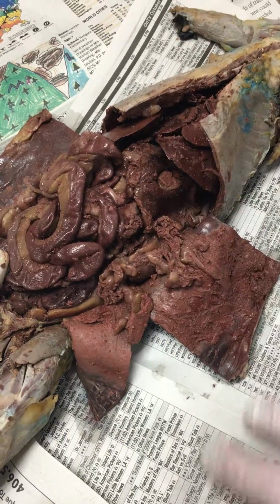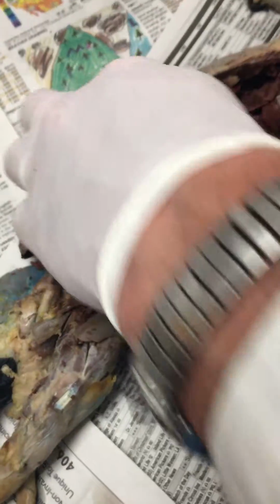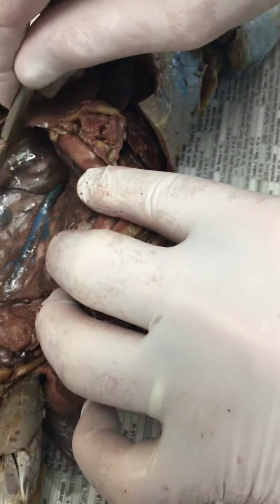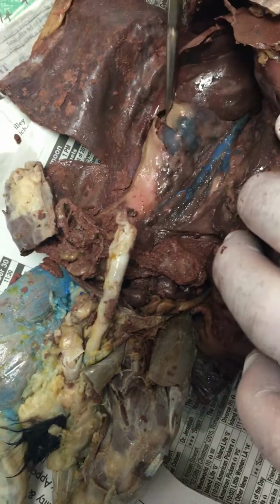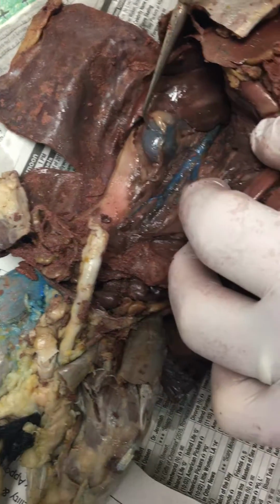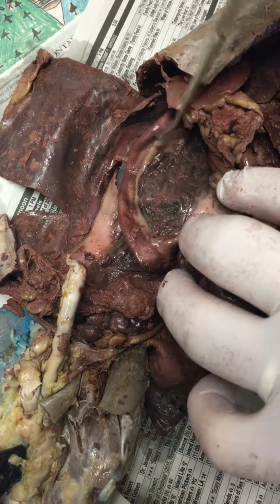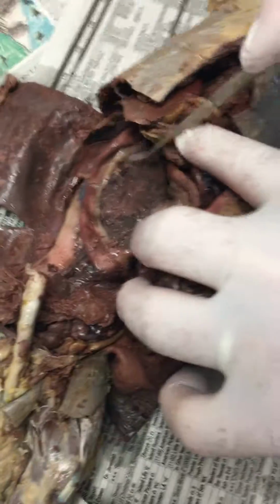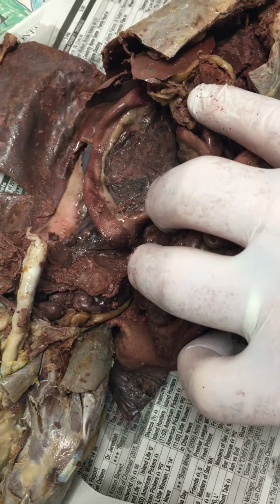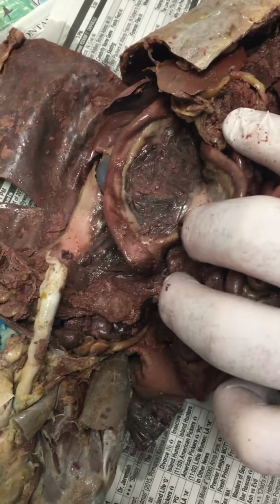To do your intestines, there are 3 parts of the small intestine and 3 parts of the large intestine. You lift all of your guts up so you're looking at the back side of the animal, where you've got the kidney here. This organ right here is the kidney. Let one flap of the intestine drop. That's the duodenum. And the organ contained in the mesentery of the duodenum, that's the pancreas. The pancreas is all of this stuff in that mesentery.